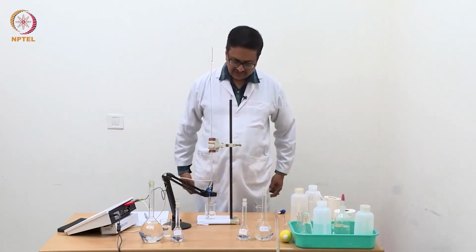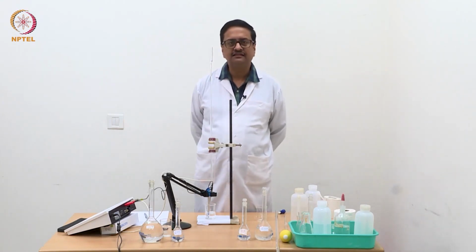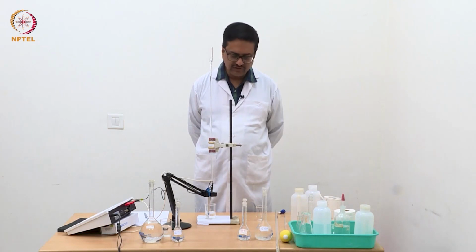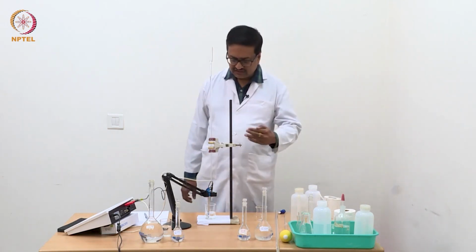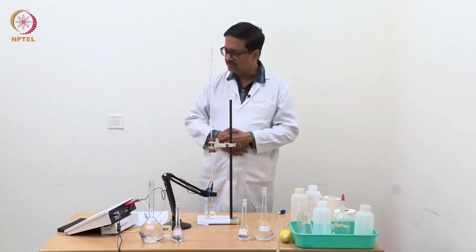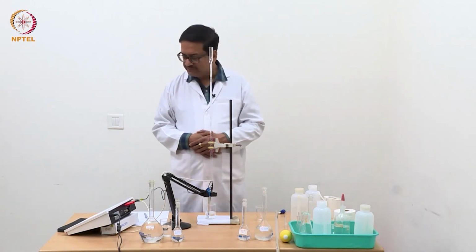So today in the first experiment I am going to demonstrate the conductometric titration of a strong acid, that is hydrochloric acid, with a strong base. Before we start the actual experiment, I would like to explain a bit about this conductivity meter, which you can see on your screen.